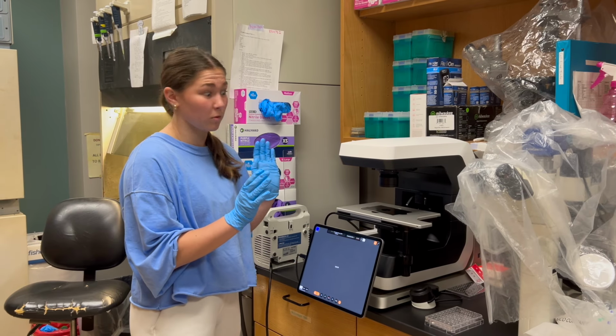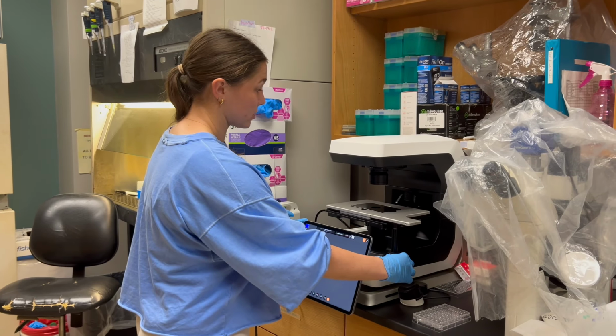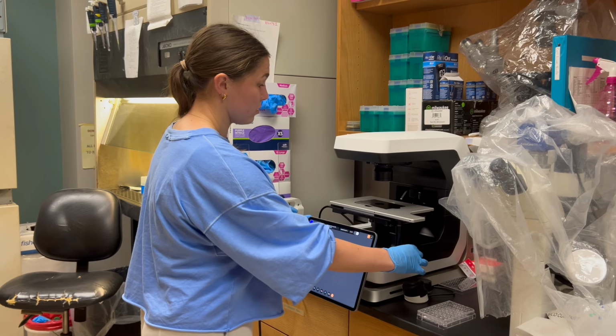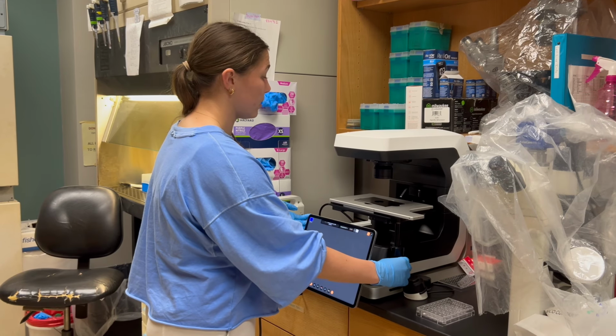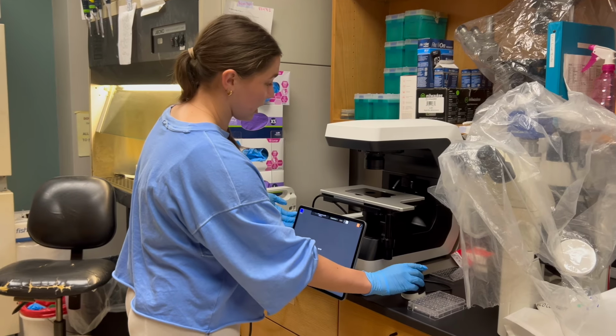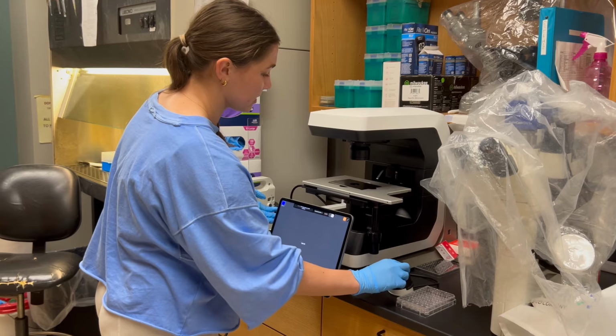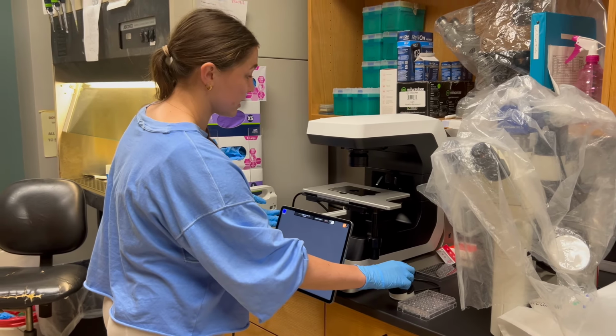Next, a couple pointers before getting into using the microscope. You're gonna have this knob right here. That's going to be for moving your stage up and down. The smaller knob below it will be for moving it side to side. You have this knob right here, which will be coarse and fine focus. So this larger knob will be coarse focus. This smaller knob will be fine focus.